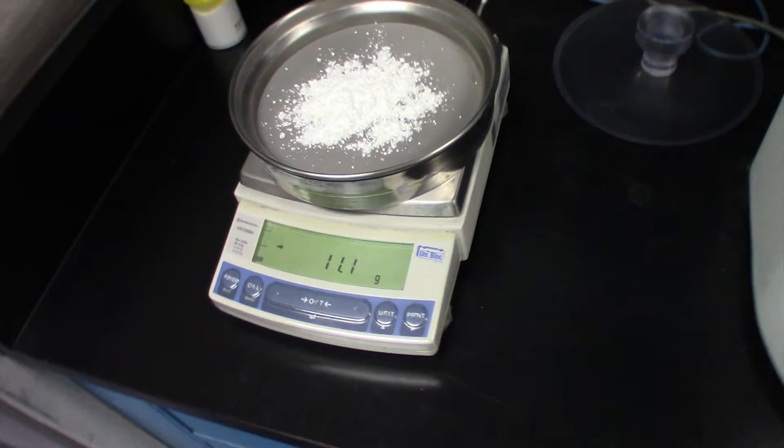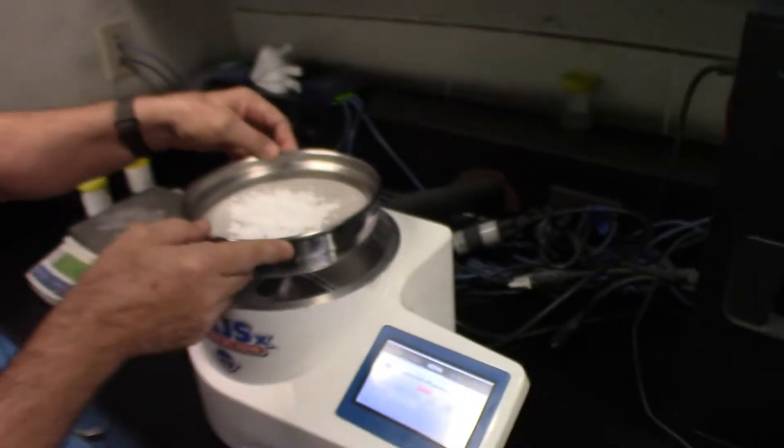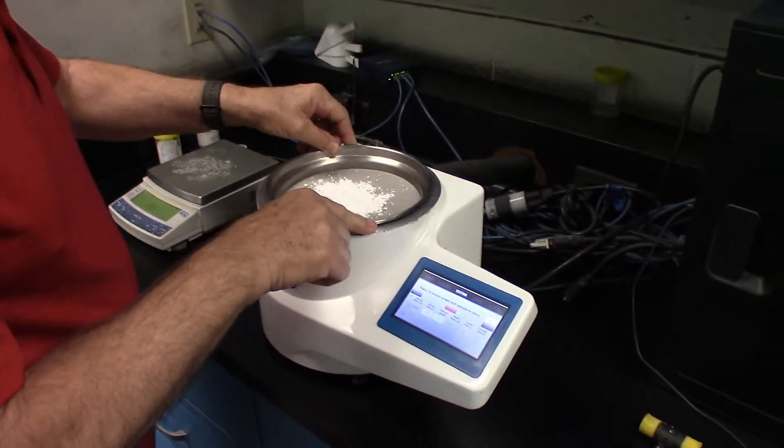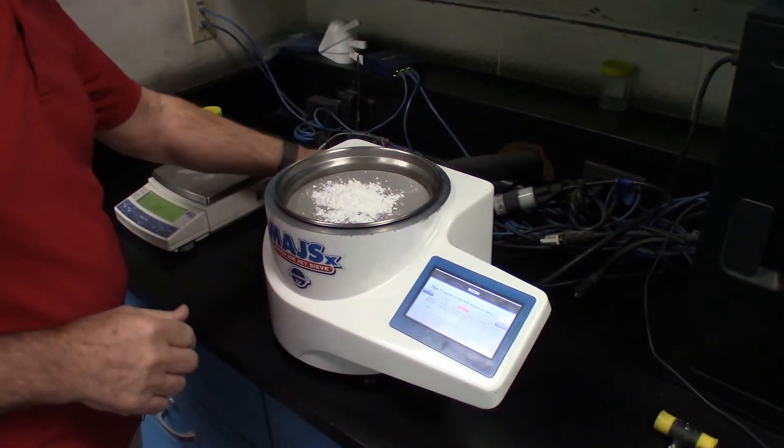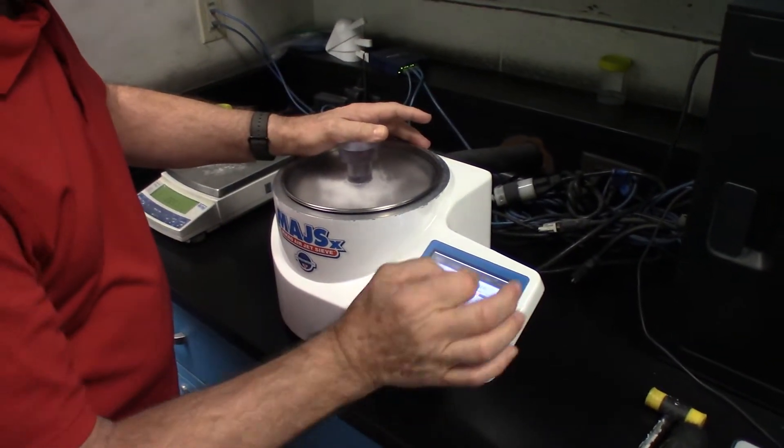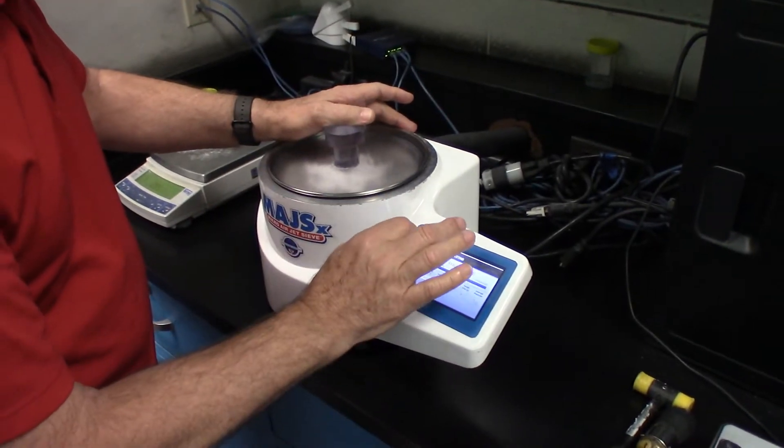We've got 11.1 grams. We place the 75 micron screen on the instrument, put the lid, advance, and press start.